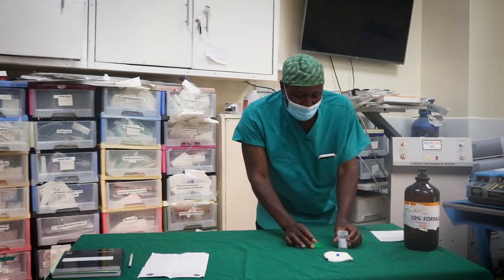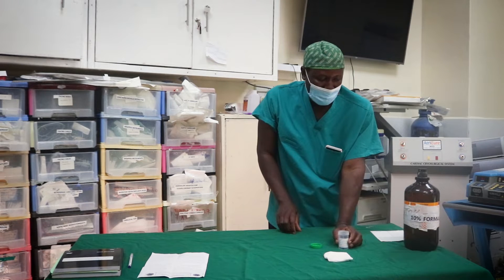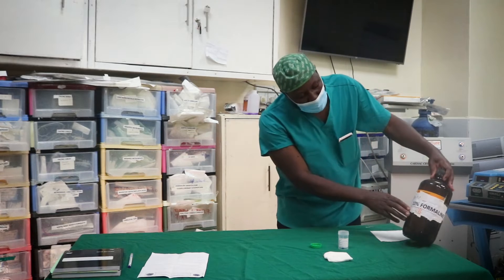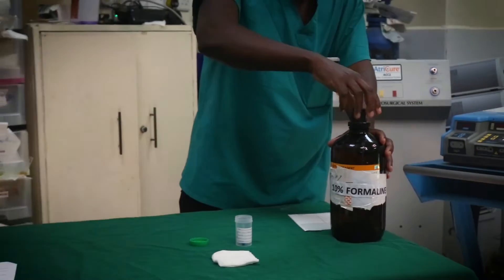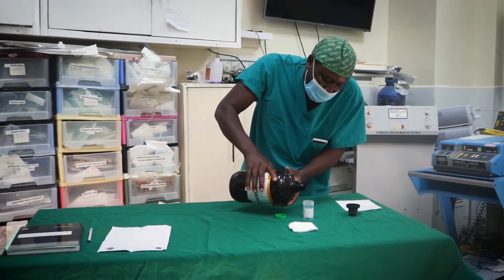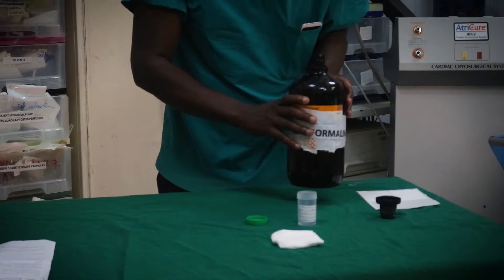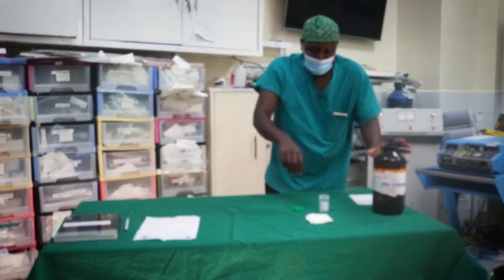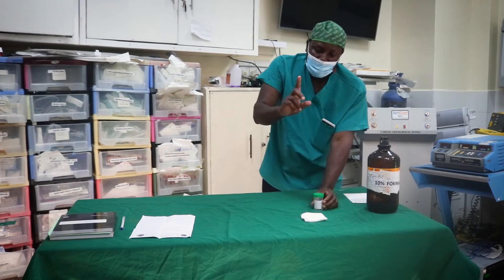After opening the container, take the tissue and put it in the container. After putting the tissue in the container, we have a tissue preservative solution called formalin — here we have 10% formalin. Take the formalin, open it, and pour the formalin into the tissue container.